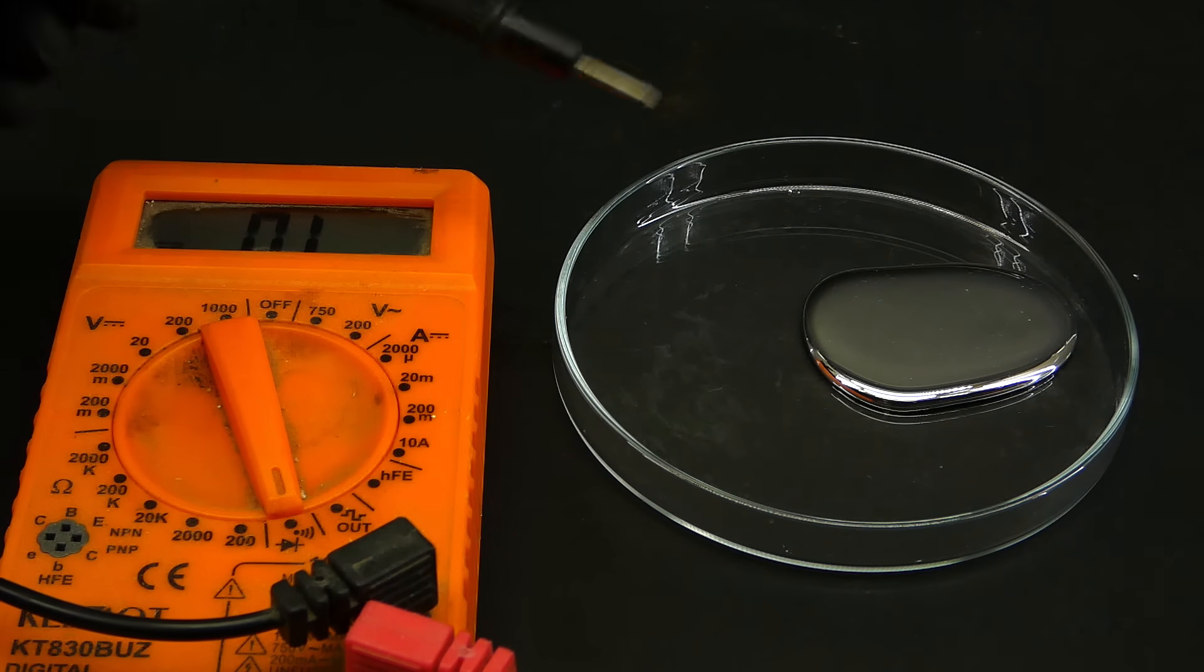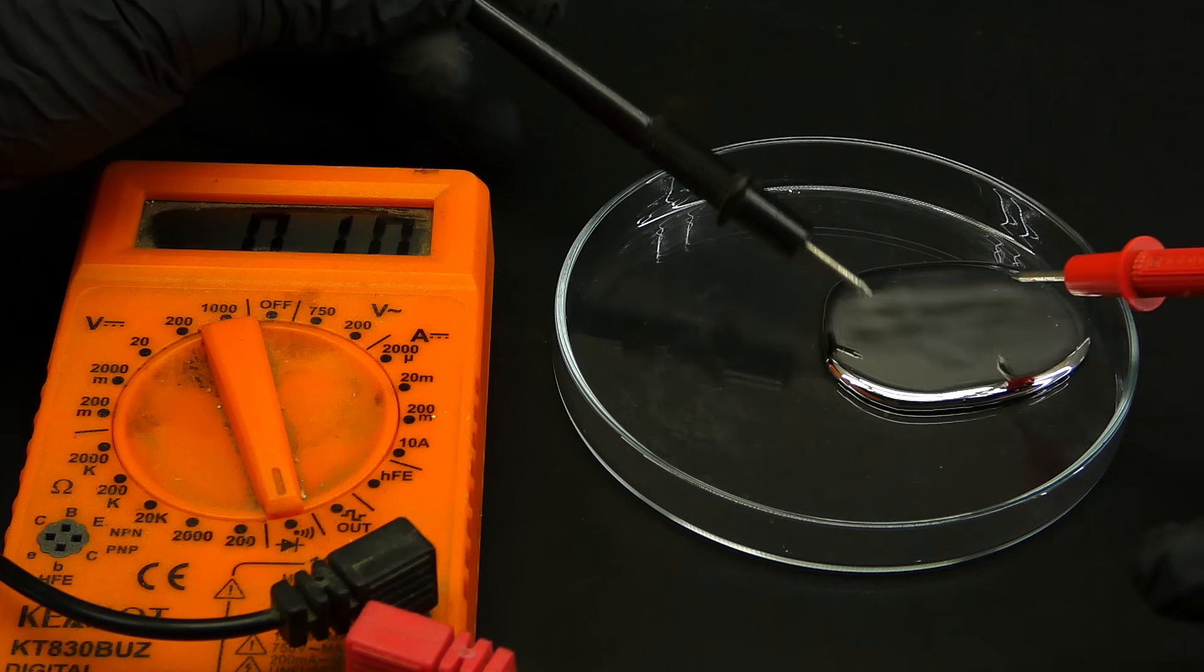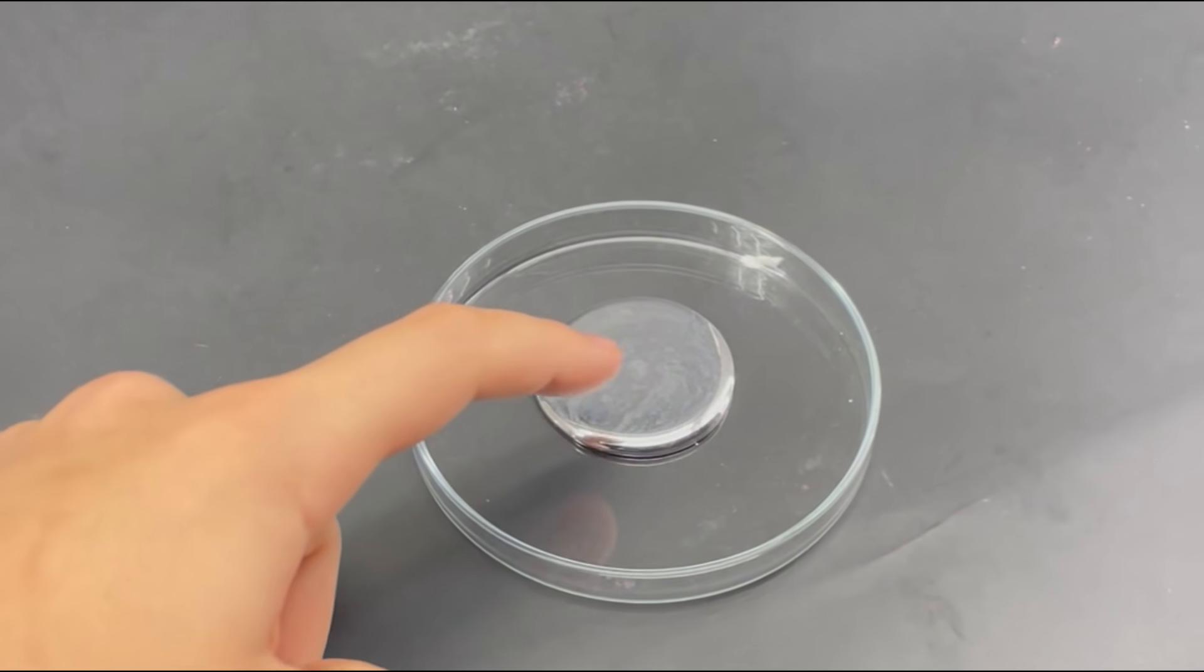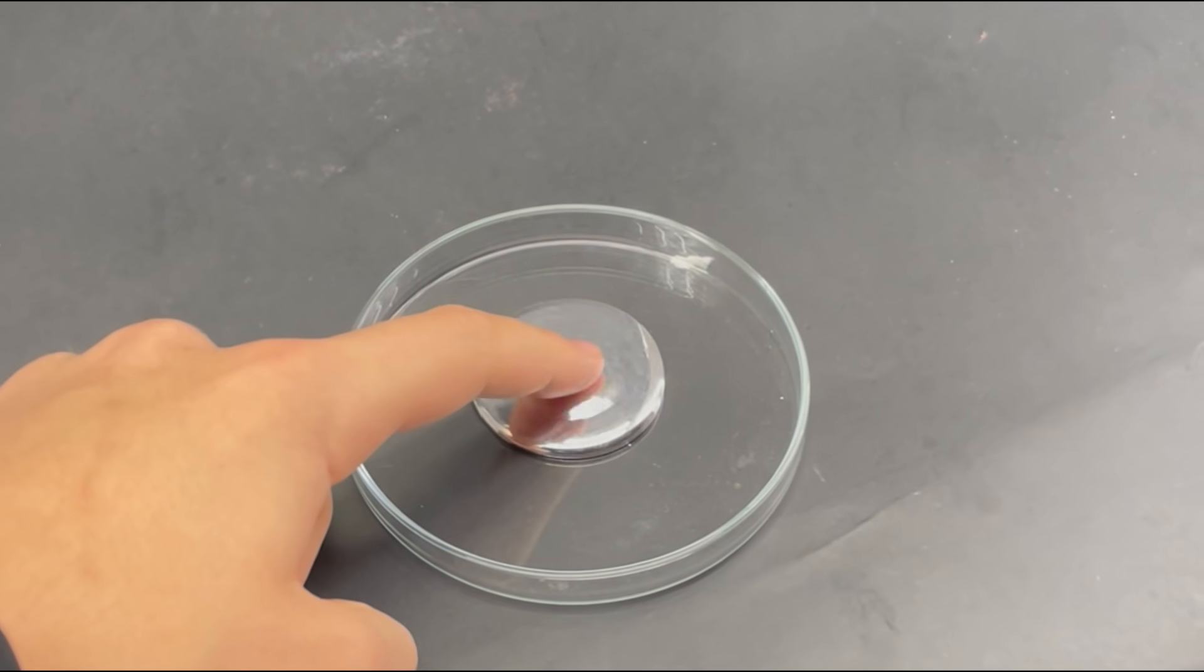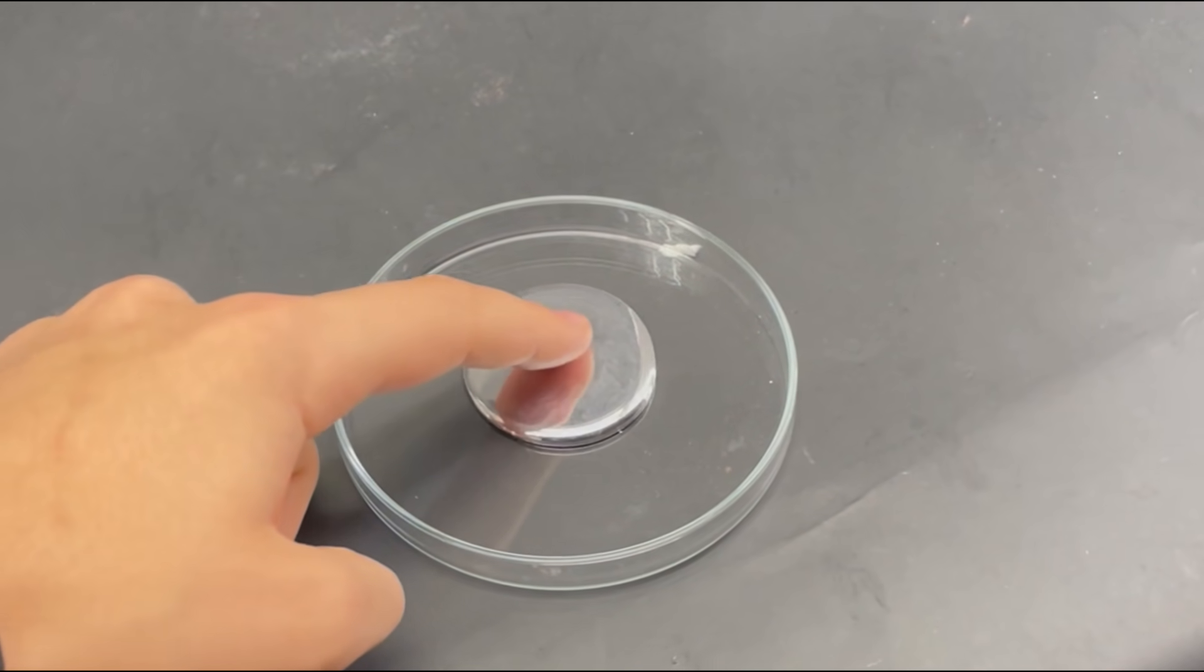Also, since it is a metal, it conducts electricity very well, and that makes it find a use in a lot of tilt switches or relays. Metallic mercury is also kind of OK to touch. Upon contact with my finger, it just feels cold, and now I see why people really like to play with it.